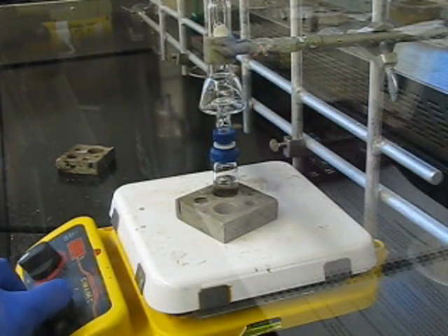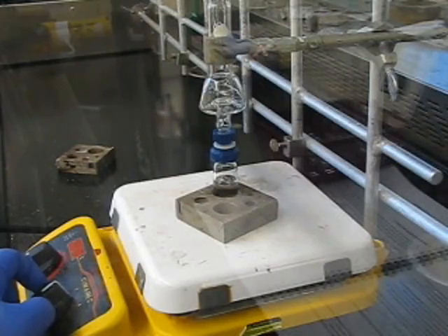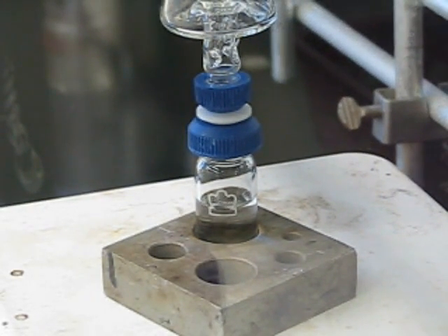You're going to hook your glassware together as your TA shows you. You've got a round bottom vial, 10 mil, with a Hickman distillation head connected with a Teflon connector — it's got blue on both sides. You can see this one's asymmetric; it's narrower on one end than the other, so it can only connect one way.